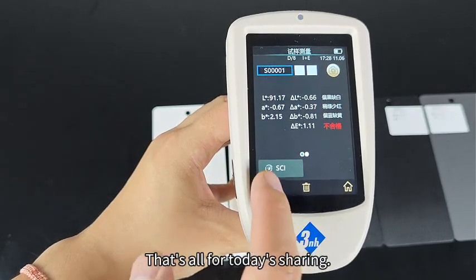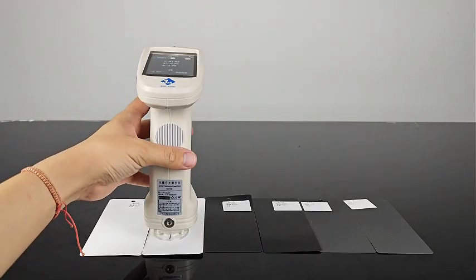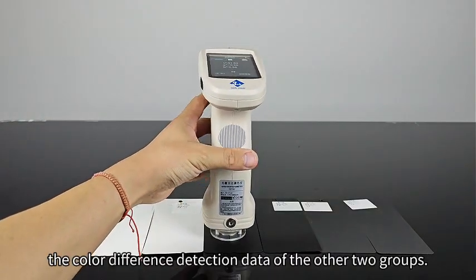That's all for today's sharing. I'll share the color difference detection data of the other two groups.